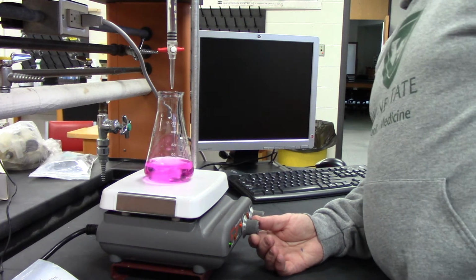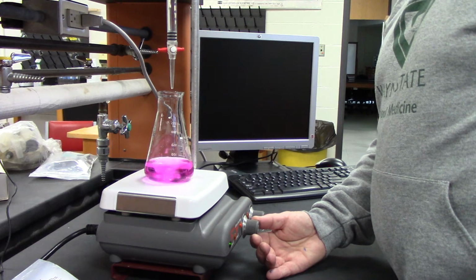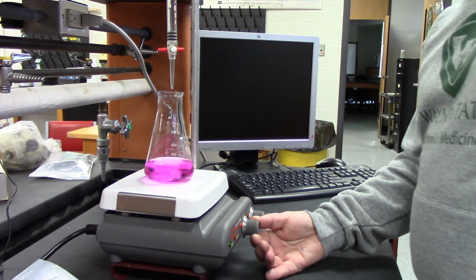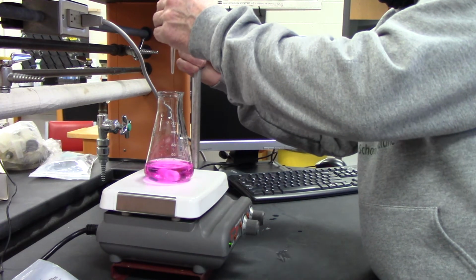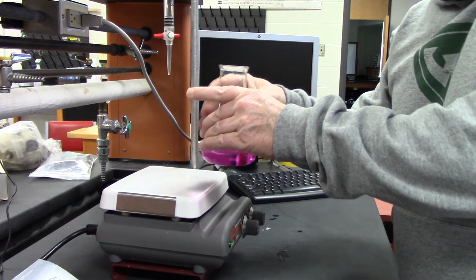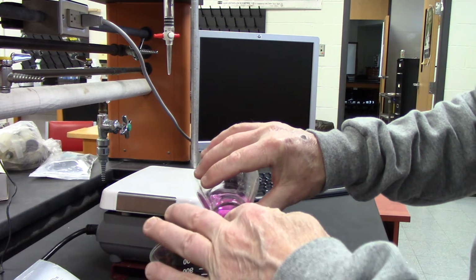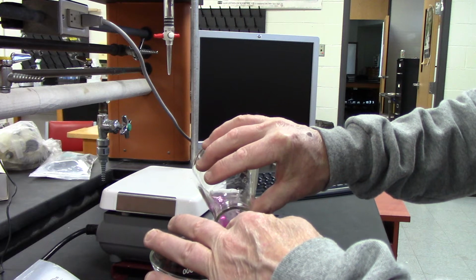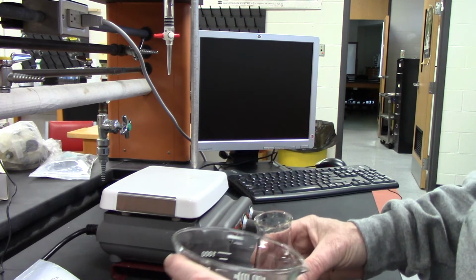So the final volume is 23.65. Okay, so I'm gonna empty this out and do my waste. Okay. Whoops.